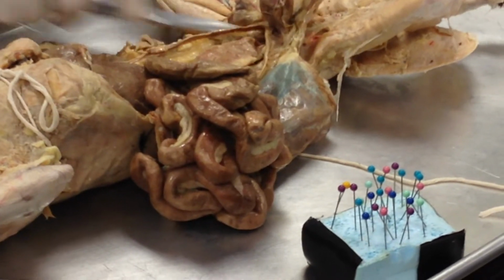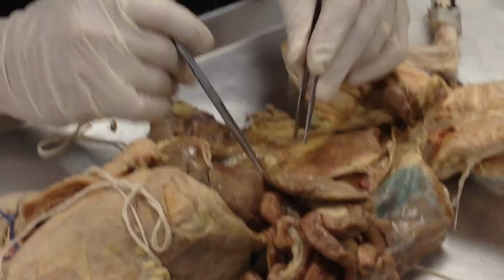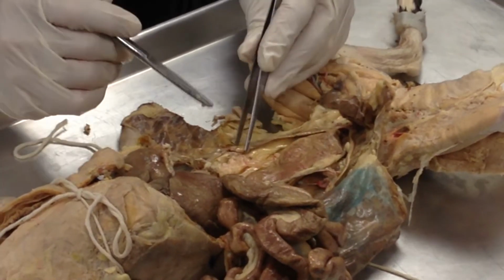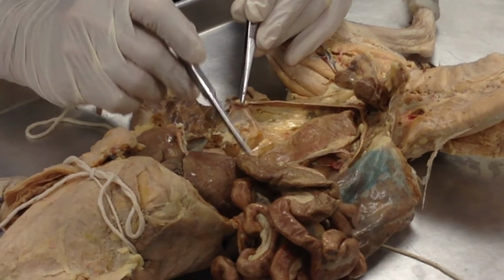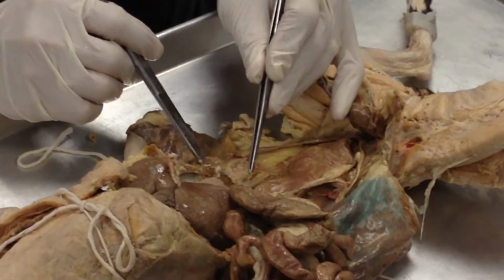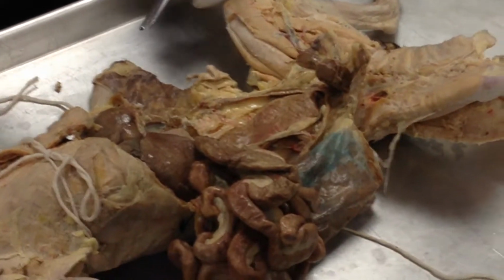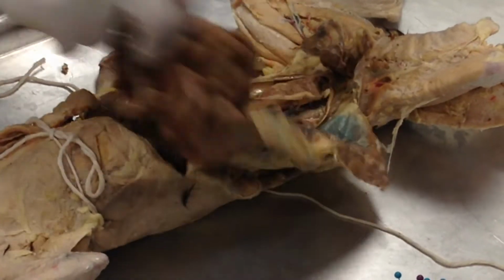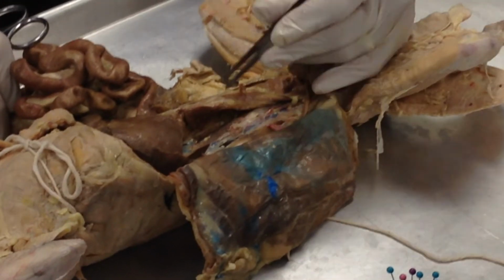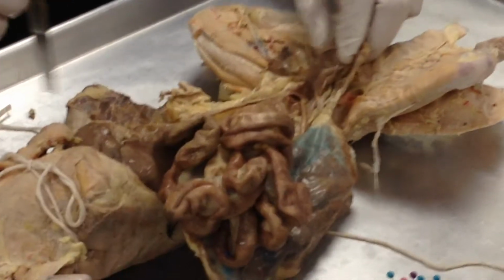Alright, then there is the kidney on the left hand side, and I really can't see the ovarian vein running up to the kidney. There it is, but look how thin it is, which is analogous to the testicular artery and vein that we saw on the human, right? And there it is on that side, and thin. All right, we'll hold on to that thought.